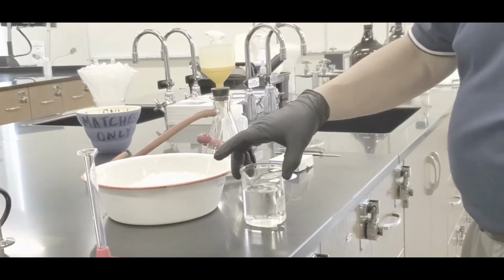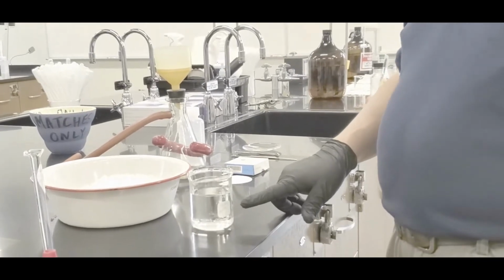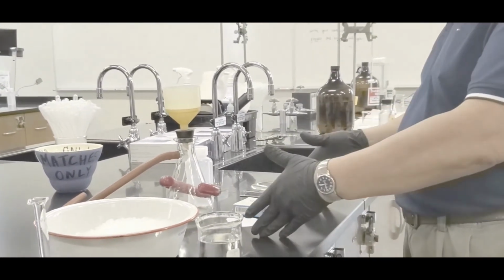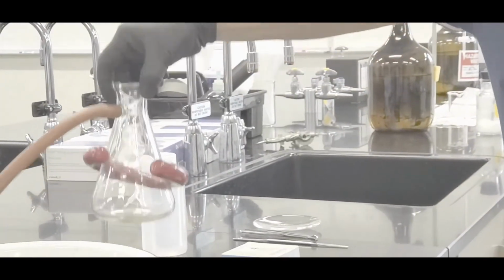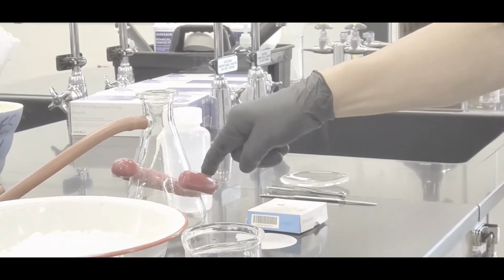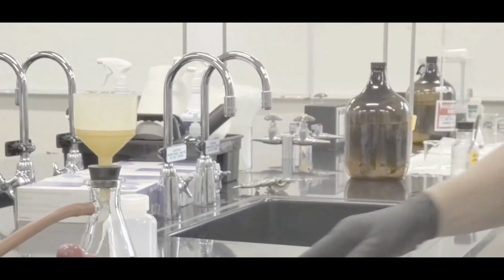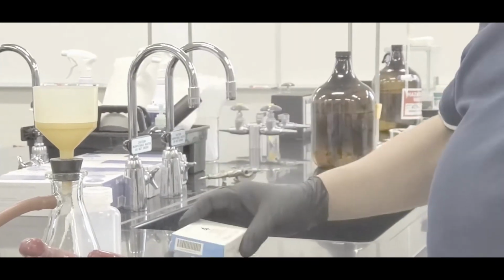You also should have a 250 milliliter beaker with deionized water or distilled water. Okay, right now I'm just showing you guys the equipment. So this is for chilling and crystallizing your product, and then the next part here is for drying. What you got here is a filtration flask with a hose, and the donut right there is to hold it down so that when you're working it doesn't flip on you. And then here's a Buchner funnel. Okay, it's separable like that. And then you should also get yourself one of the Whatman number 4, 70 millimeter filter paper.